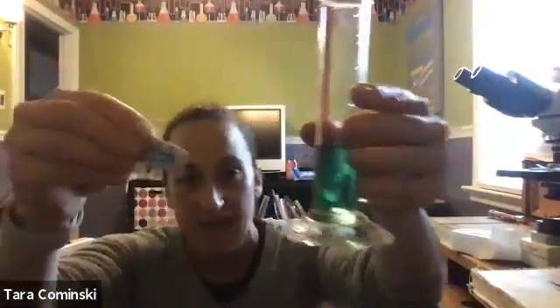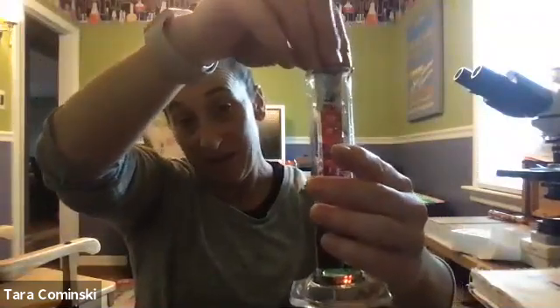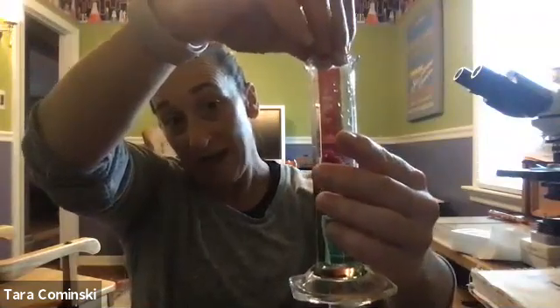Well, what if we didn't do that and we just had this and this and you didn't have a way of measuring it? What's another way of determining the volume of this, right? You can basically just put this in here. So we know it started off with the 20. We drop that in, and now I see that the water level raised up to 24, okay?